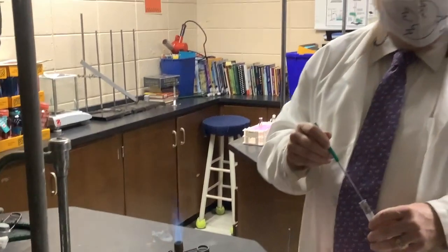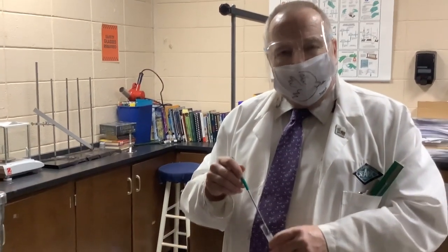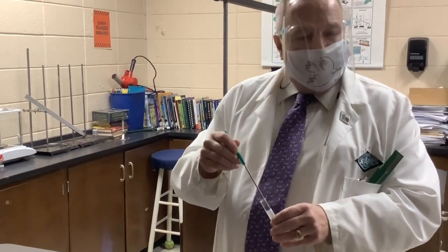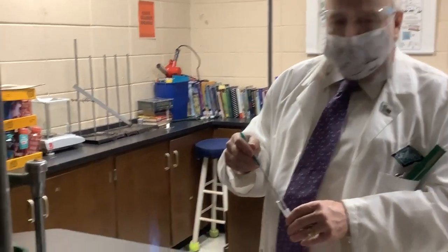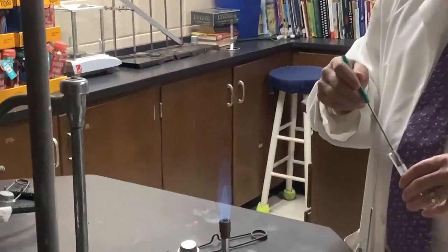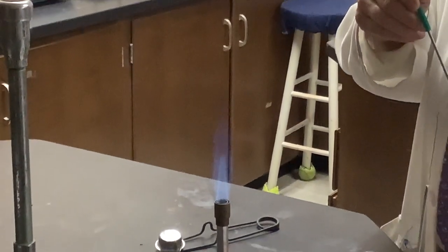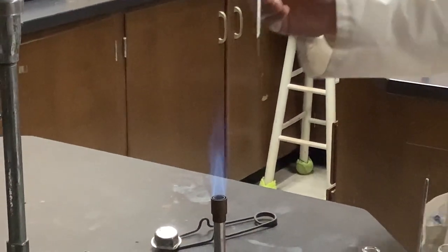And mesquite wood, if you've ever had a mesquite wood fire, glows kind of purple because it concentrates a lot of potassium in the plant tissues as it grows. Mesquite trees do. So watch carefully and you'll see a lilac flame. This one again is a quick one though. This one isn't one that is a persistent color. This one is very short-lived.